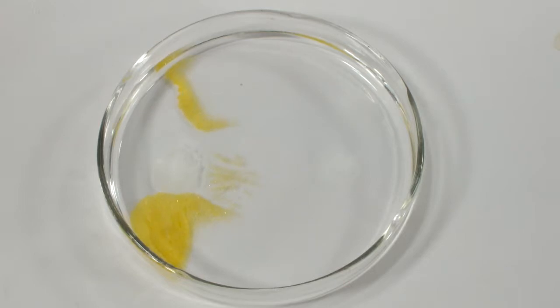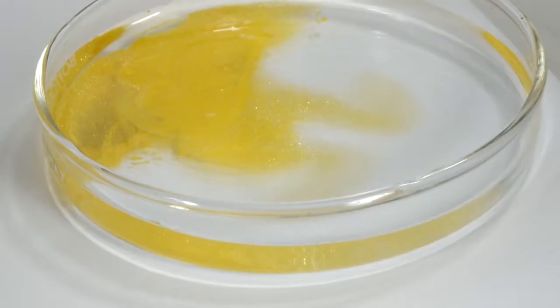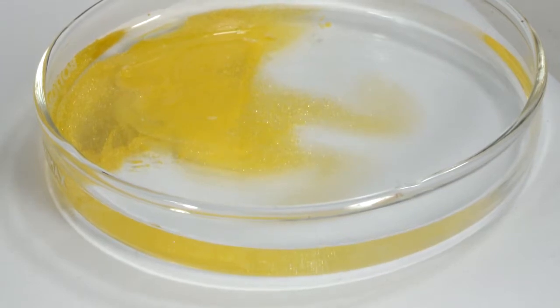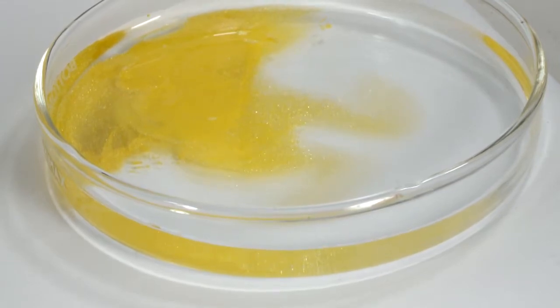Iodine is a big heavy atom, but this is a nice demonstration that shows that the lead atom is bigger and heavier. Within about a minute, the lead nitrate is no longer visible, so I'm not sure if it's completely dissolved or not, but there's an awful lot of lead iodide in there anyway.